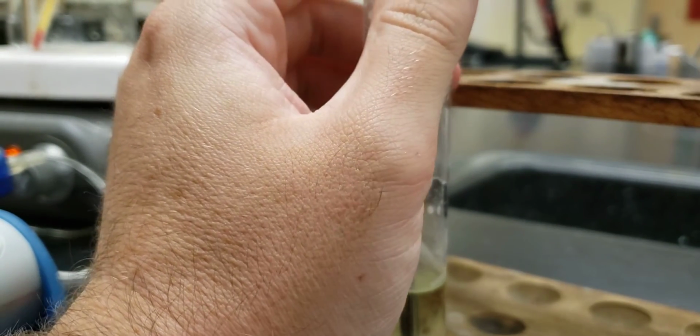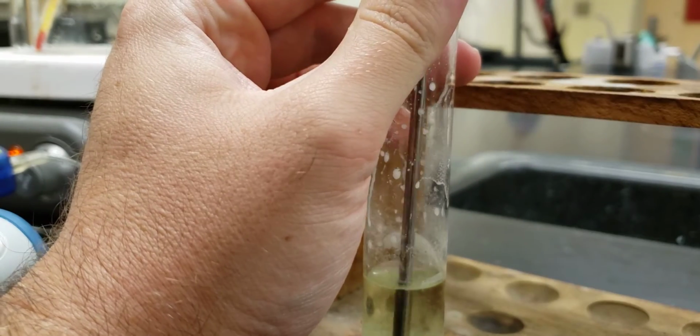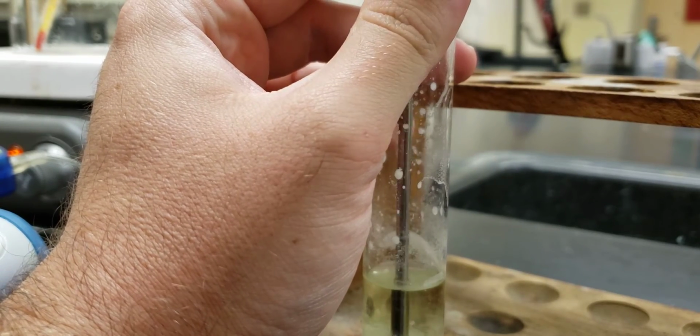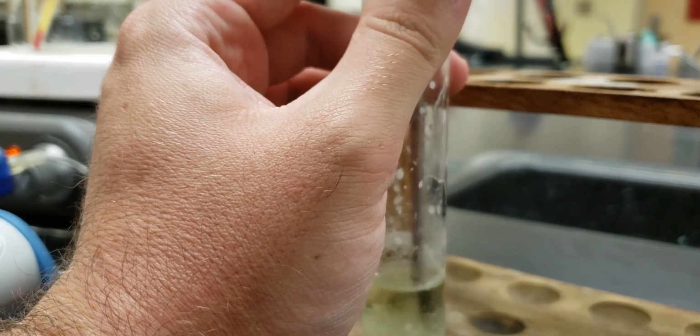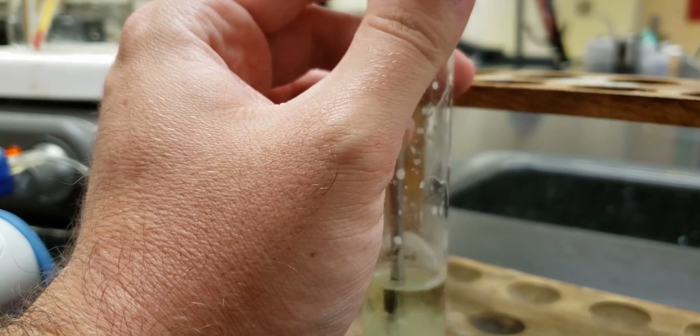As long as our data collection tool does not freeze out, which ours might.